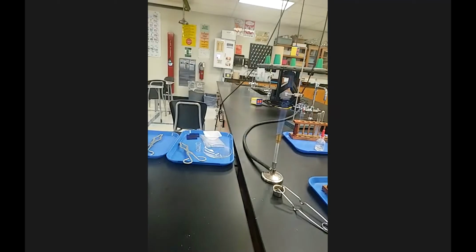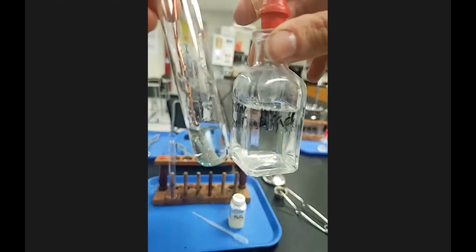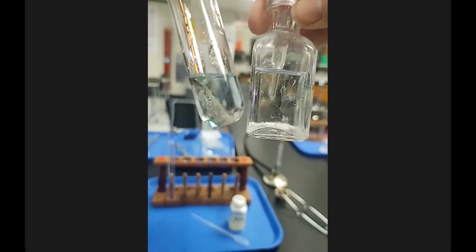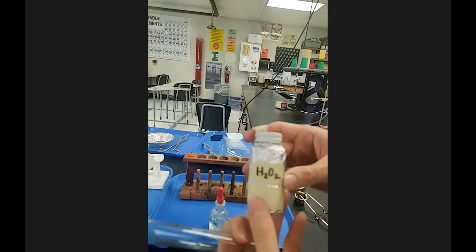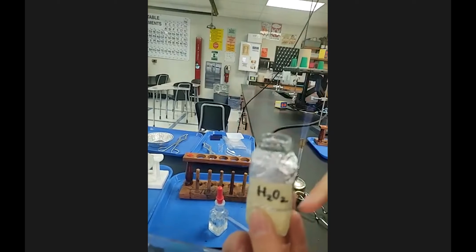So station 3 here, and just to hold up a different solution, a translucent one as well, there's definitely a hue to this one that the bleach does not have. So that's an important note for station 1. All right, station 3 talks about getting a test tube, adding some hydrogen peroxide, and hydrogen peroxide is also light sensitive, so that's why this bottle is wrapped in aluminum foil.